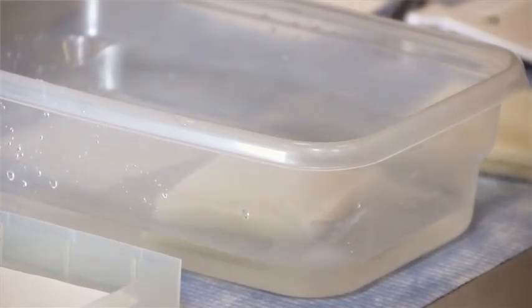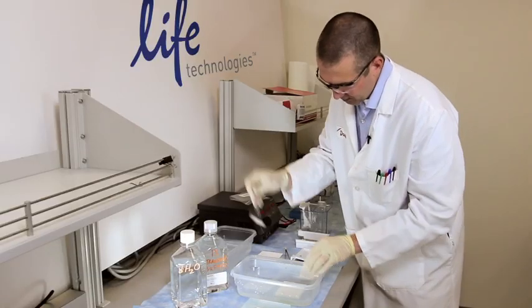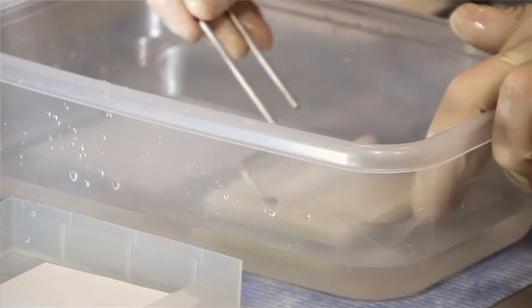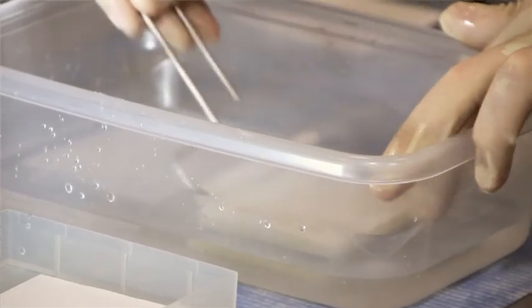I'm going to carefully lay them on top of the filter paper. Next I'm going to take this little roller here and roll out any bubbles that may be between the gel and the filter paper.